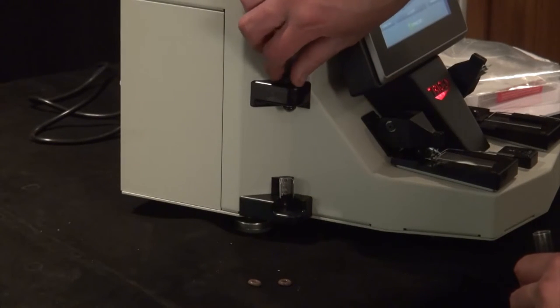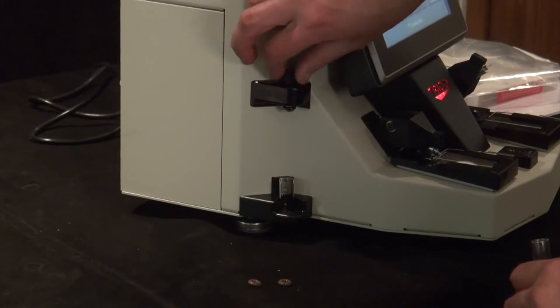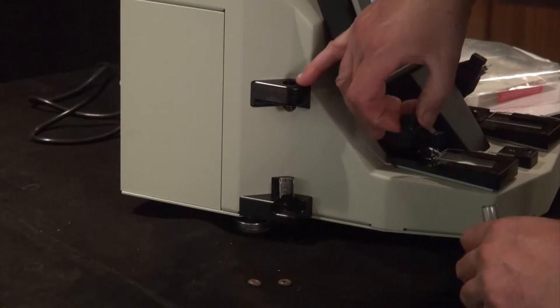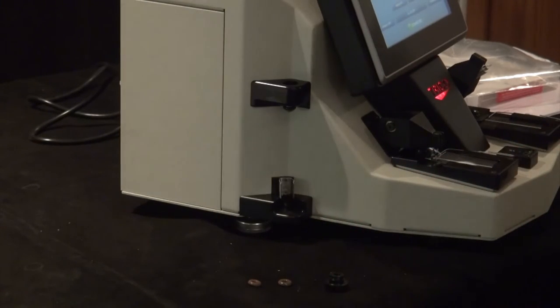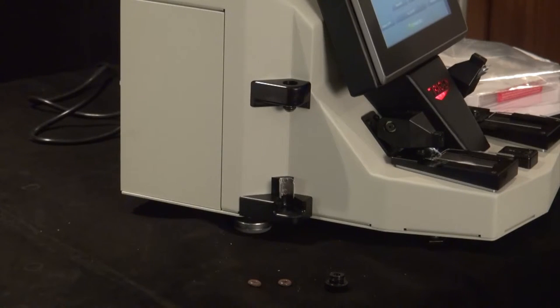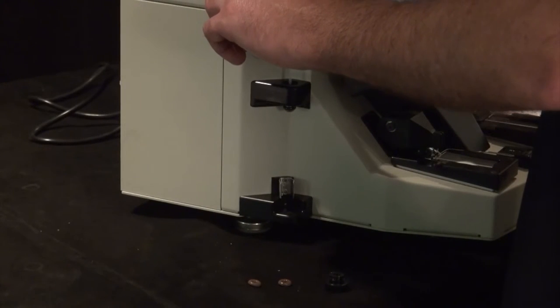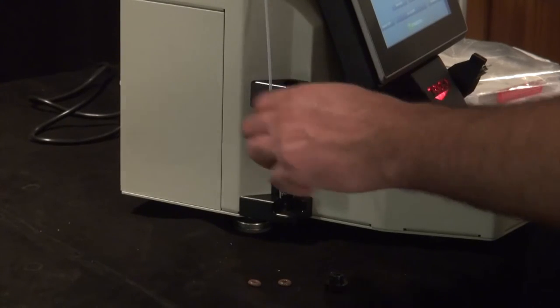And then the top O-ring, if you take the cap off, it just unscrews. There is a tiny O-ring on the inside. To replace that, what we'll do is just take your sample tube and put it through the O-ring and pop it out. And now it's on the sample tube.